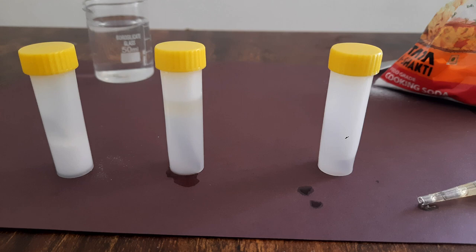When we boil water it removes all the oxygen in it — boiled water has no dissolved oxygen. A layer of oil is kept on top to prevent any oxygen present in the air from dissolving in the water. And in the third tube on the right, it has normal water — there is nothing like baking soda, no boiled water, just normal water.